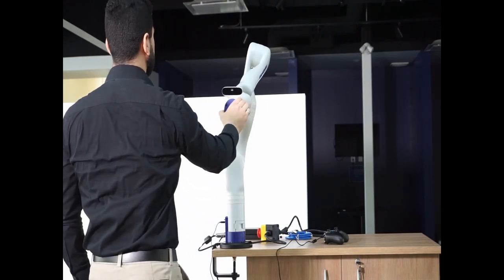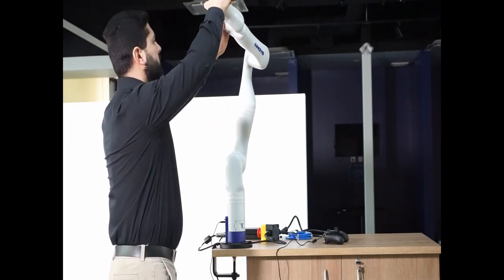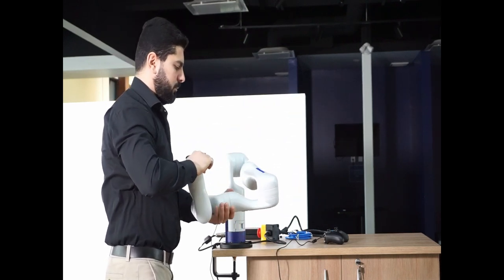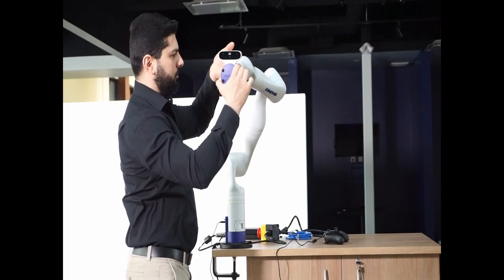When you press and hold the two hand side buttons together, you can control your robot in null space admittance by applying force by hand to move joints within null space while retaining end effector position.